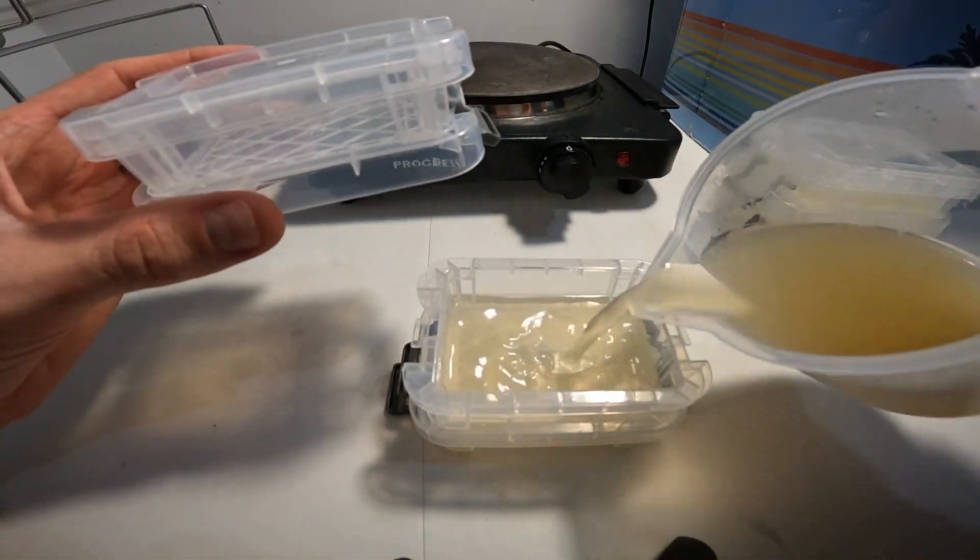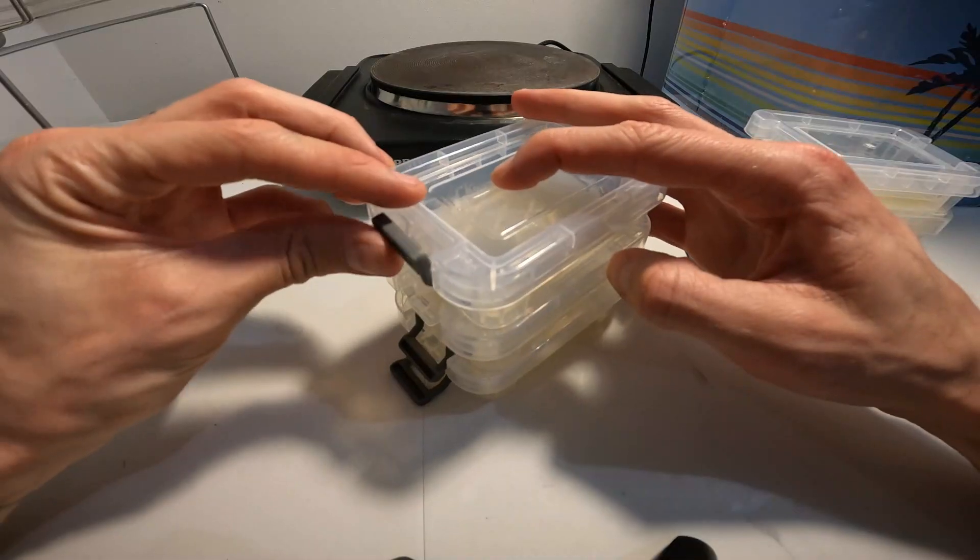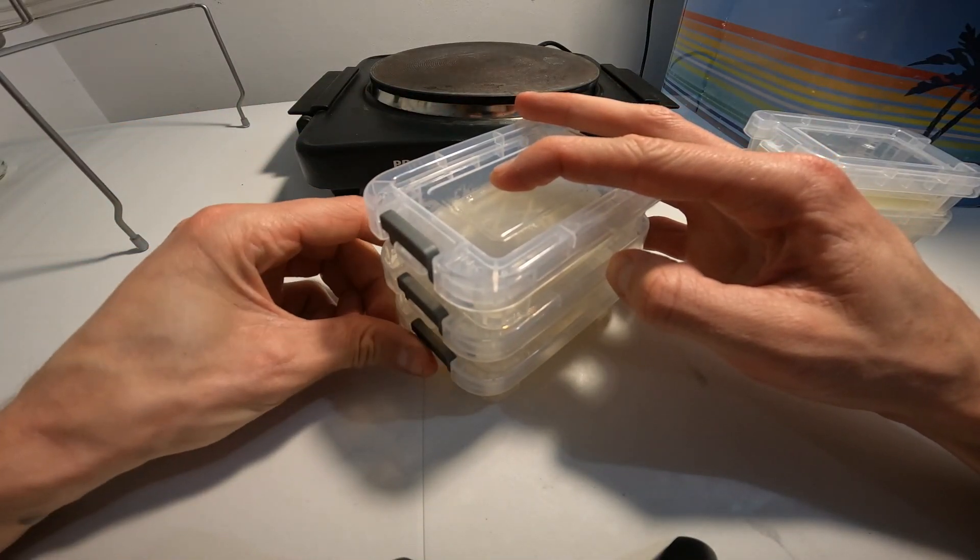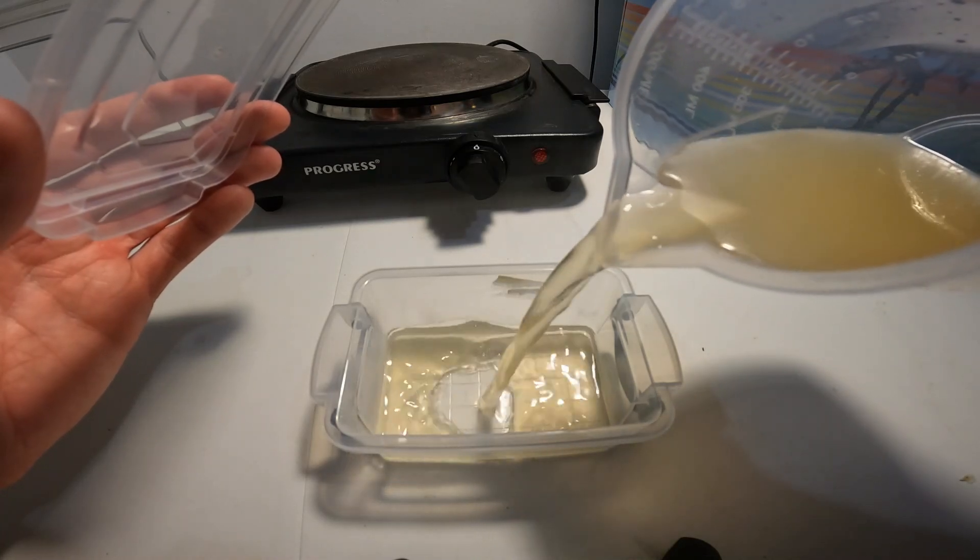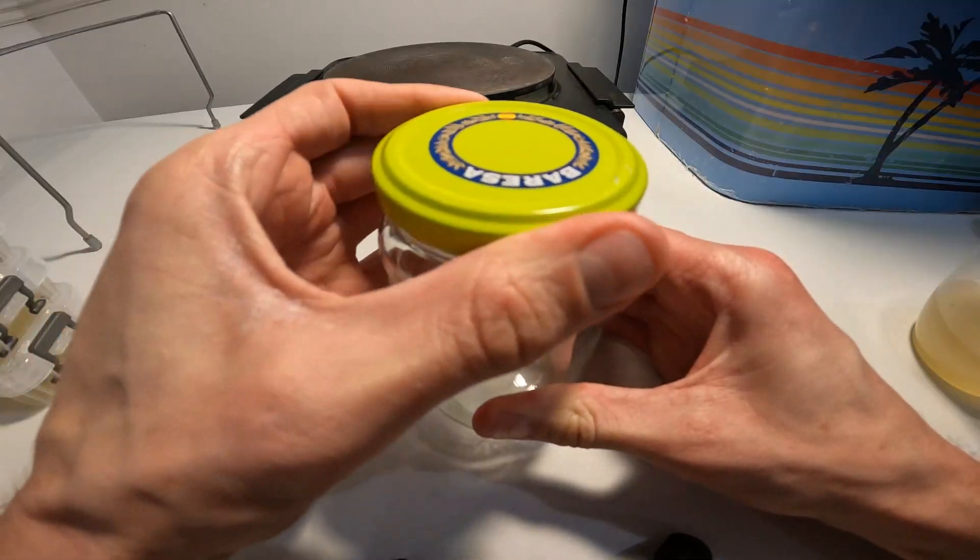After filling all 6 of the new pots, I realized I overestimated the amount of agar liquid I needed. So I just filled up one of the old pots and a jar that was also at hand.